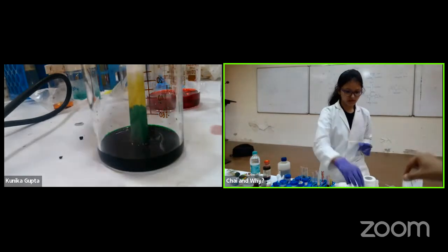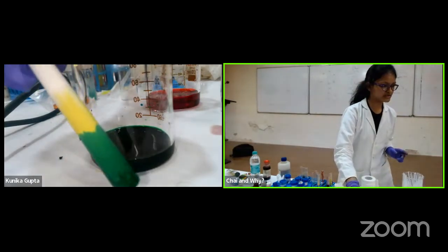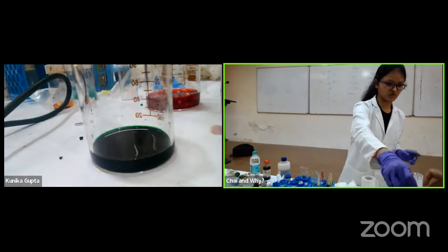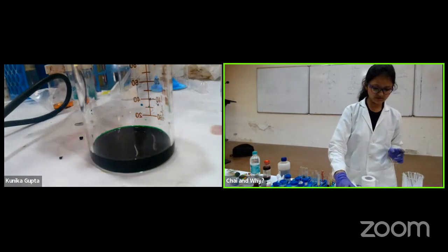Take it out now. Take this chalk, we can pass it down. So here the audience can see that the yellow has been separated from green very beautifully, and you can pass it. Now I'll mix the green with red and see if there's some difference.